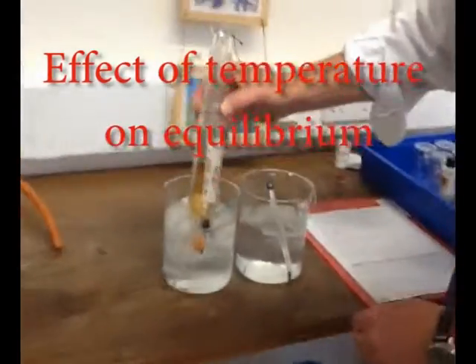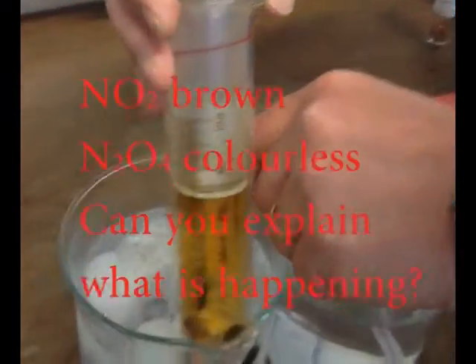You can't really see the color change on this. You have to go first. You can see how light it's gone in the cold beaker.